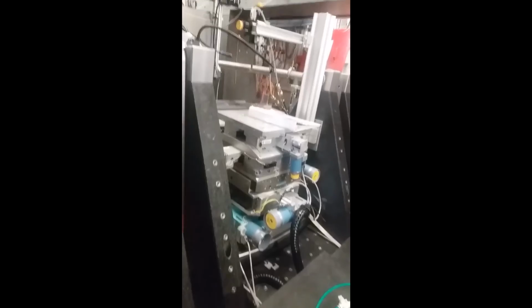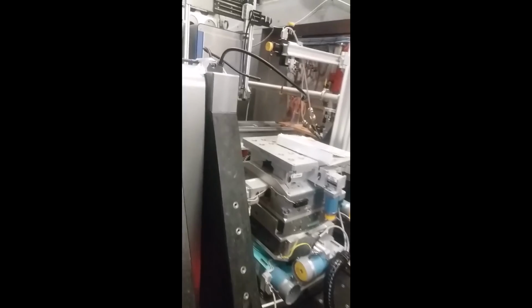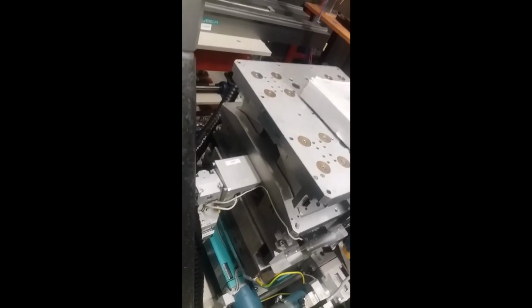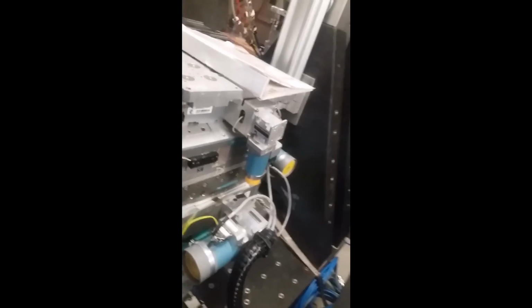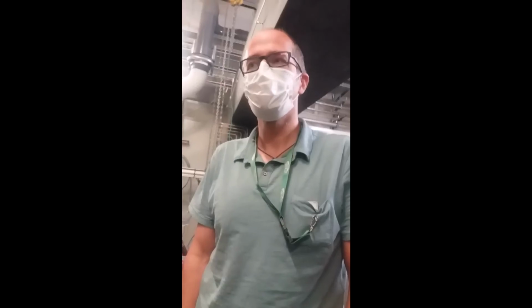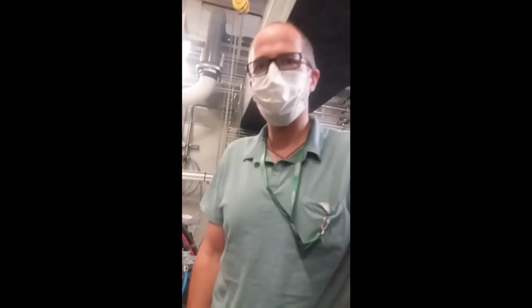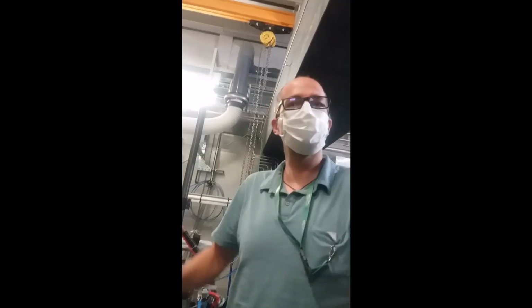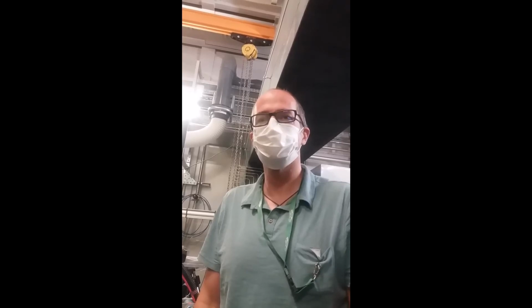Exactly, right? So we have experiments where typically people bring the lasers, they heat up the powder, right? And they look as they raster the laser through the powder bed, for example. So they look at how the powder melts and solidifies into the actual 3D print. Because that's of course a very important application question, as probably everyone from the conference knows. So we are very well set up for this kind of experiment. We are one of the few beamlines that actually does additive manufacturing in this area.